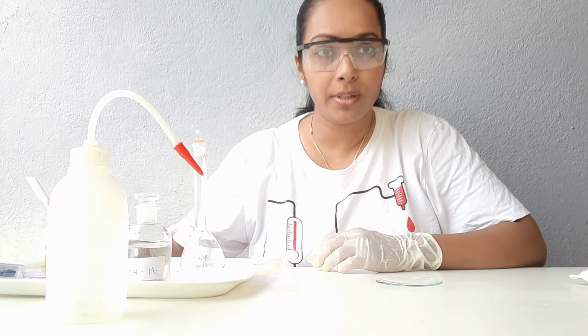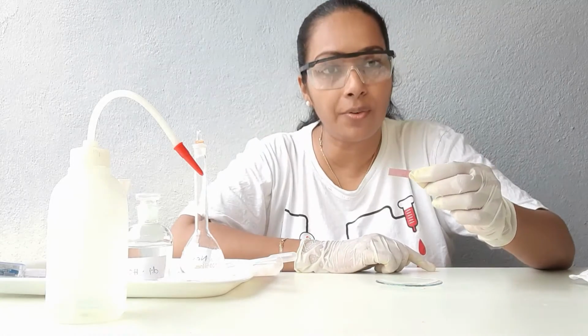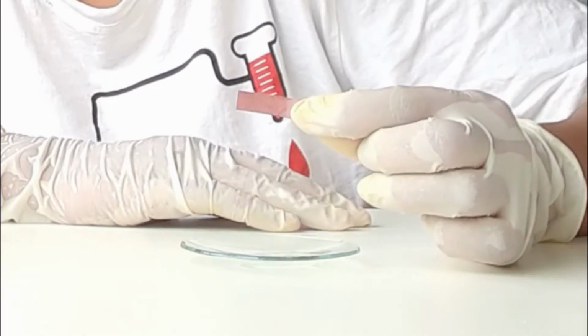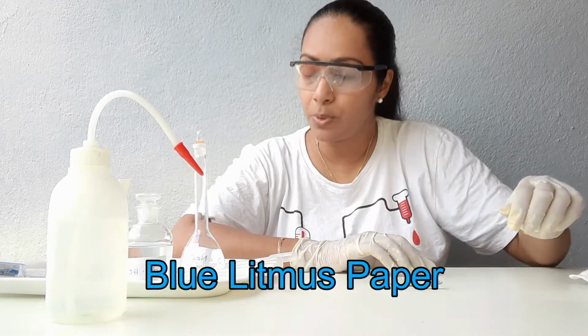Let me try out a sample of salt. I have a piece of red litmus with me. Red litmus did not change with salt. Now I'm going to try out a blue litmus paper.